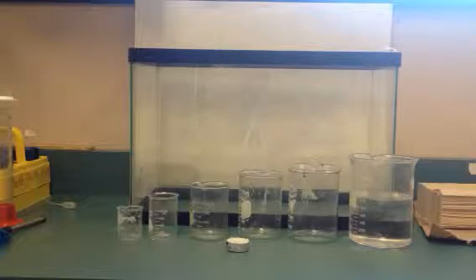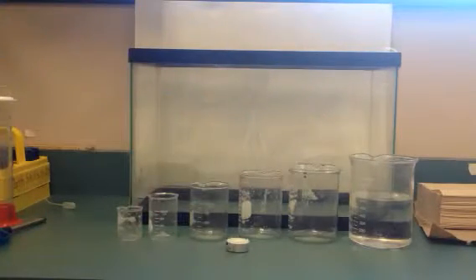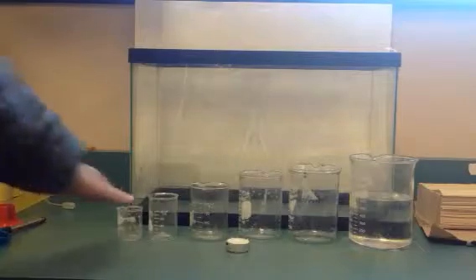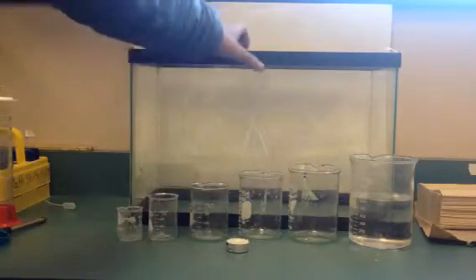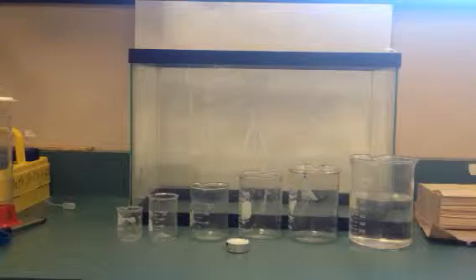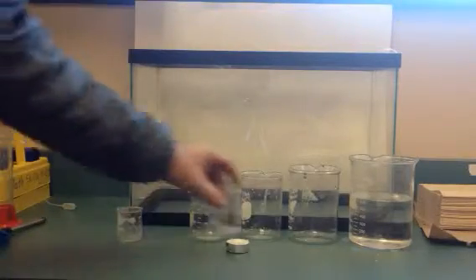One of the things that you need to know, first of all, is the actual volume of these beakers. And let me back up for a minute. We're going to use the data from the beakers to actually figure out how long it would burn in a fish tank and see how close your prediction was. So what you're going to first do is figure out the volume of the beakers.